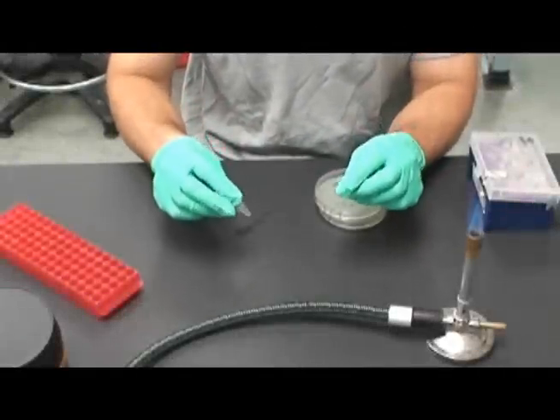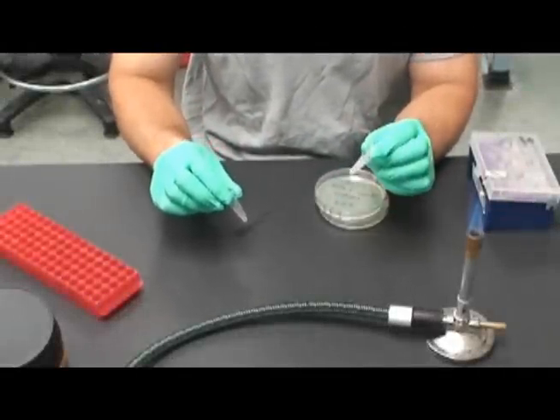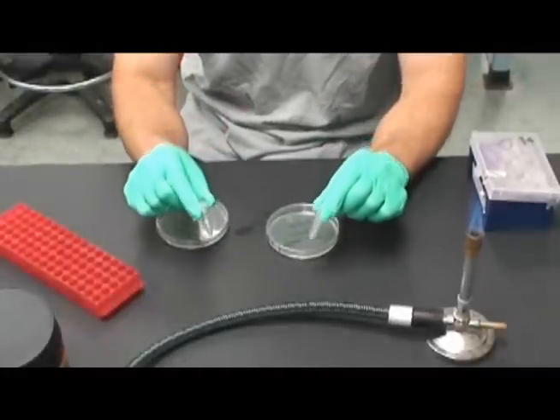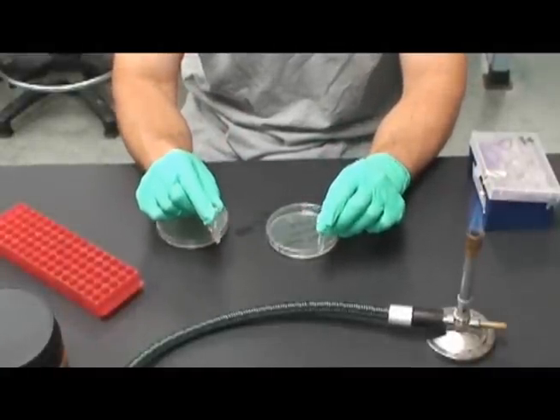Centrifuge both tubes for 2 minutes and pour off all but a drop of the supernatant. Vortex briefly to re-suspend, then spread the contents of the tubes onto the third and fourth plates.